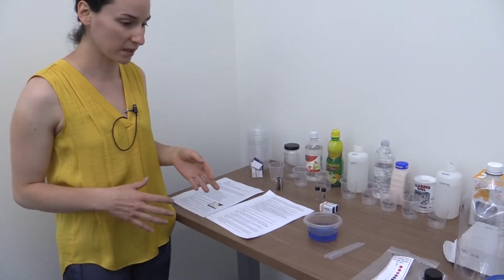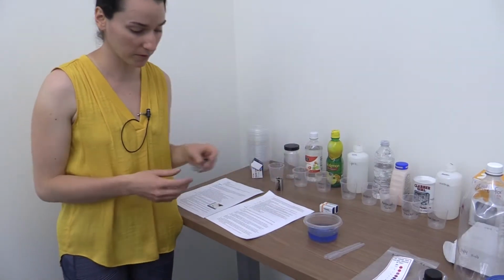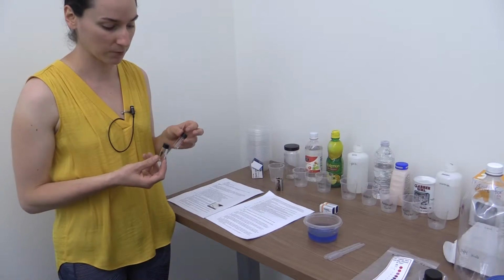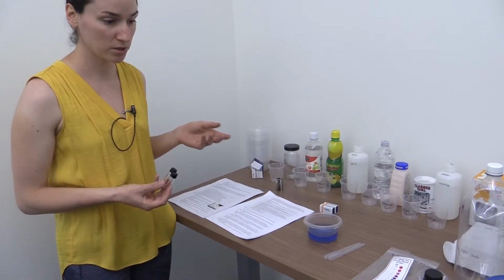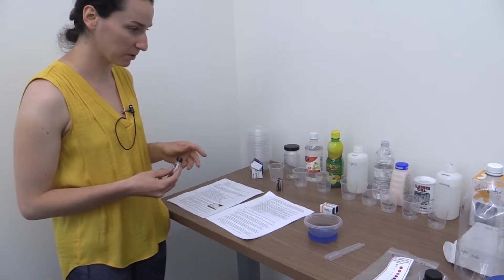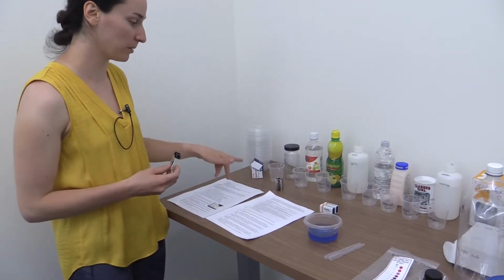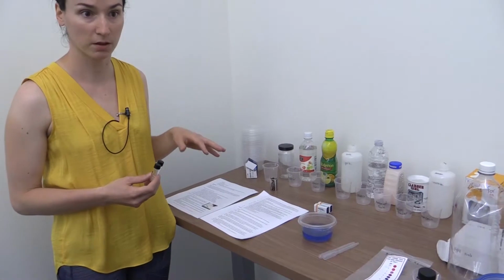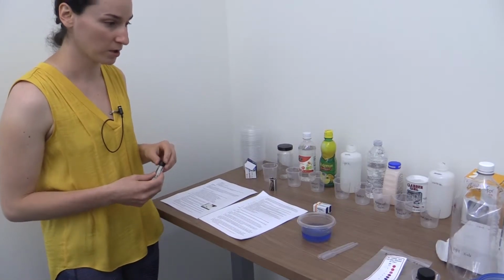And so what I did is I had each group make a series of indicator solutions, and we labeled the vials with Sharpies so that we could reuse these in future years and not have to worry about residue from something basic being left over in the material. So just make sure each table group gets a set of 1 through 8, and then we would have them put some red cabbage juice indicator solution into the vials and then come up and either add a squirt of vinegar or lemon juice, and we would have all these plastic beakers filled with the product so that if they spilled, it wasn't as wasteful, just in case anything got knocked over.